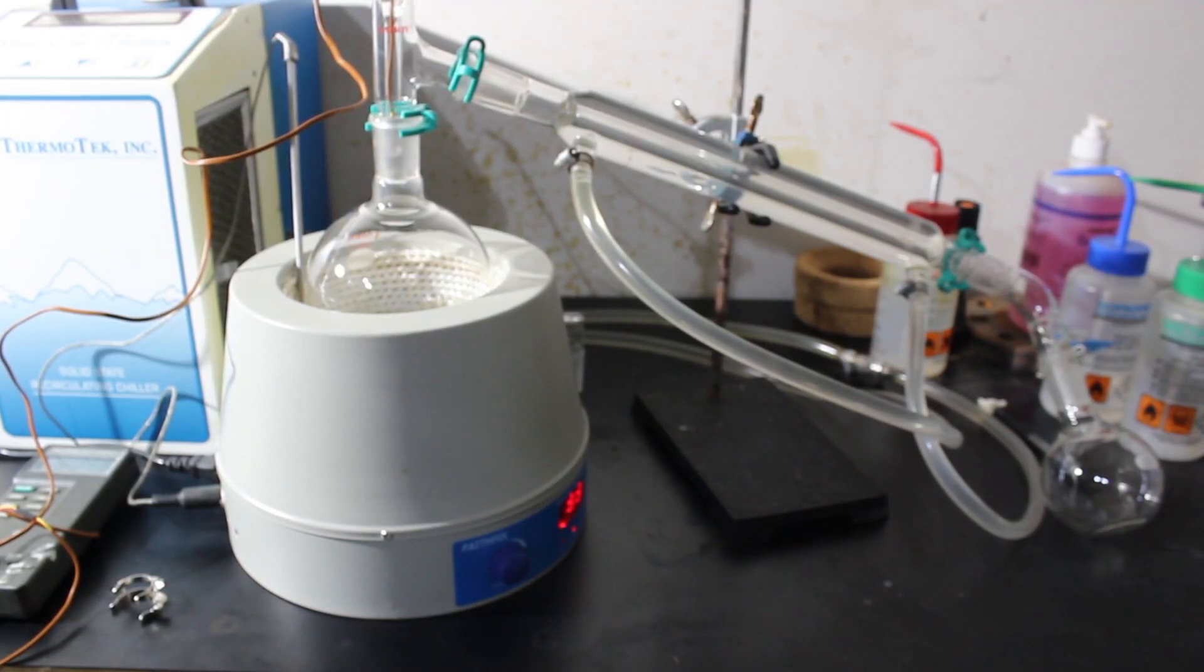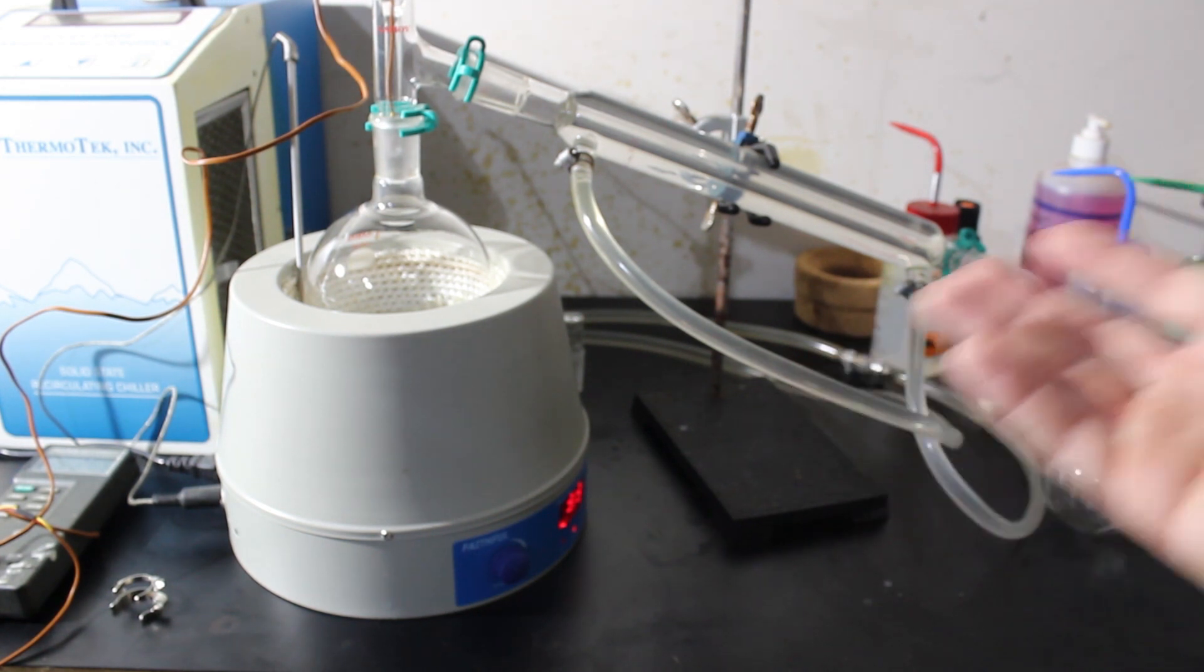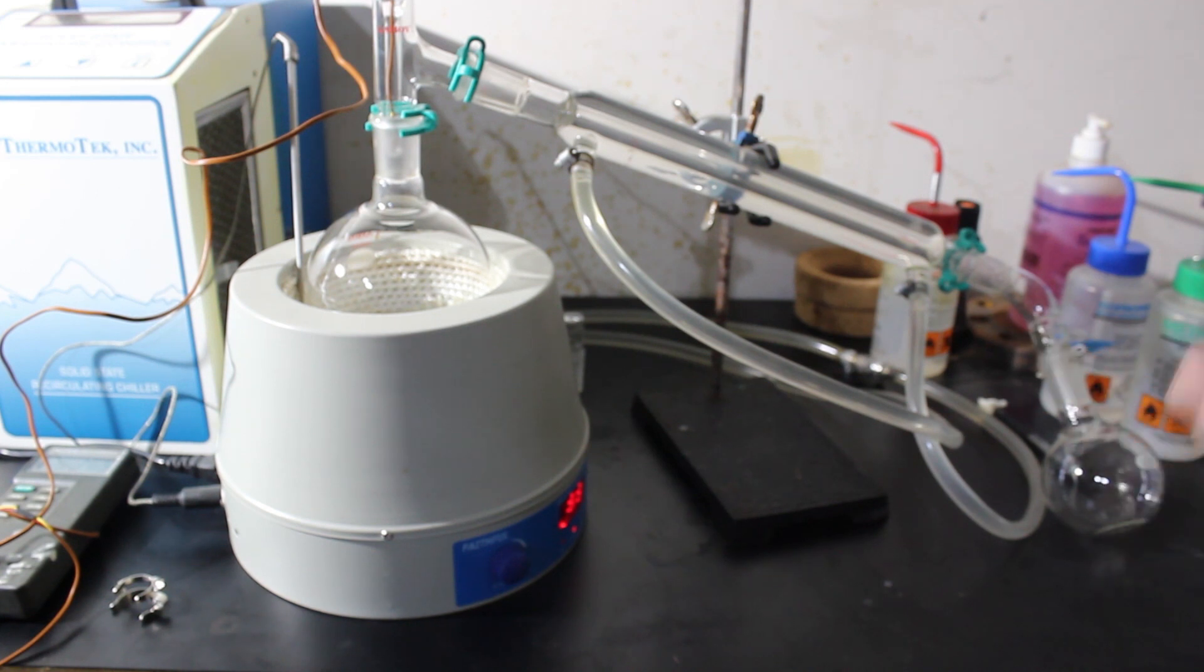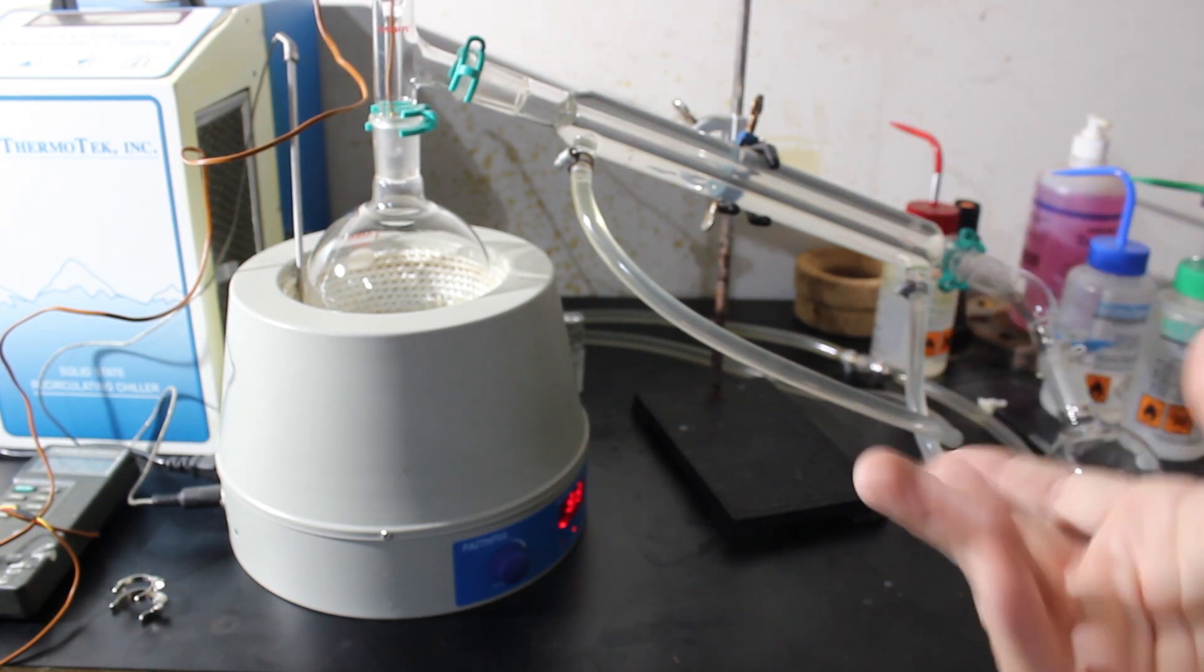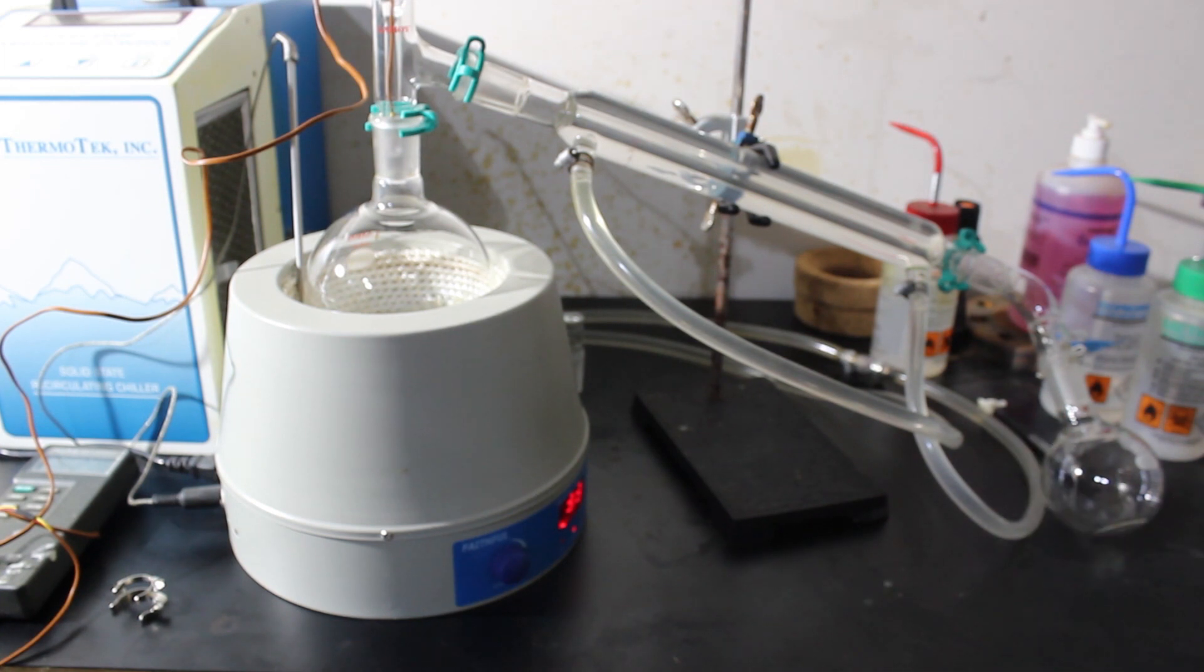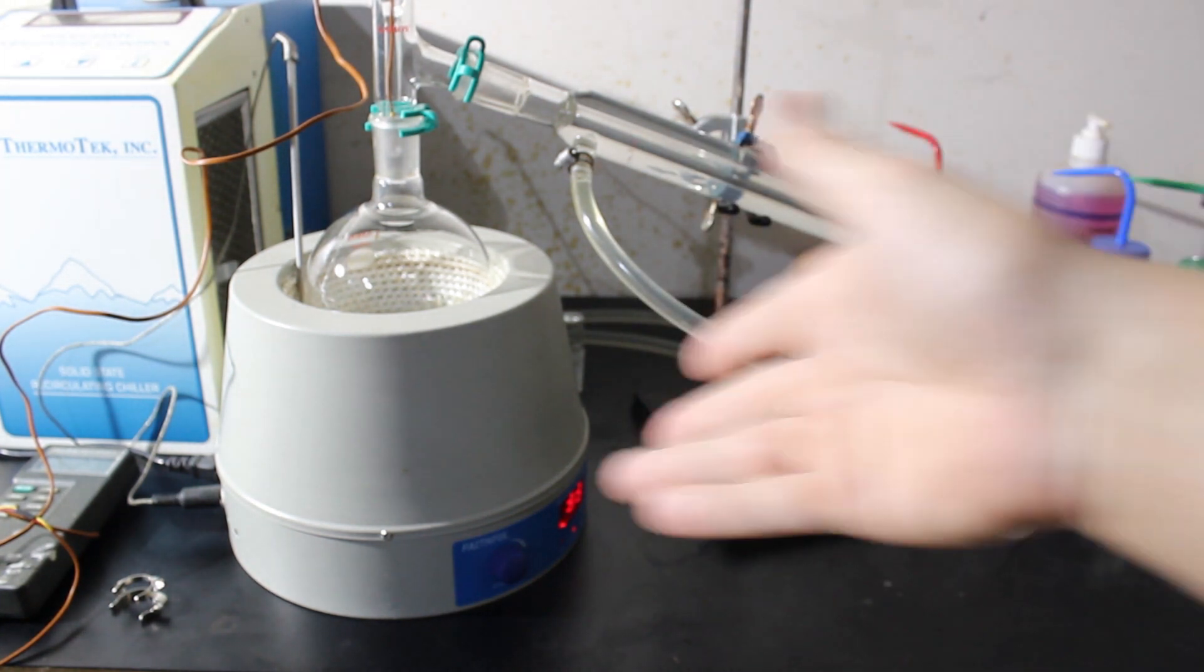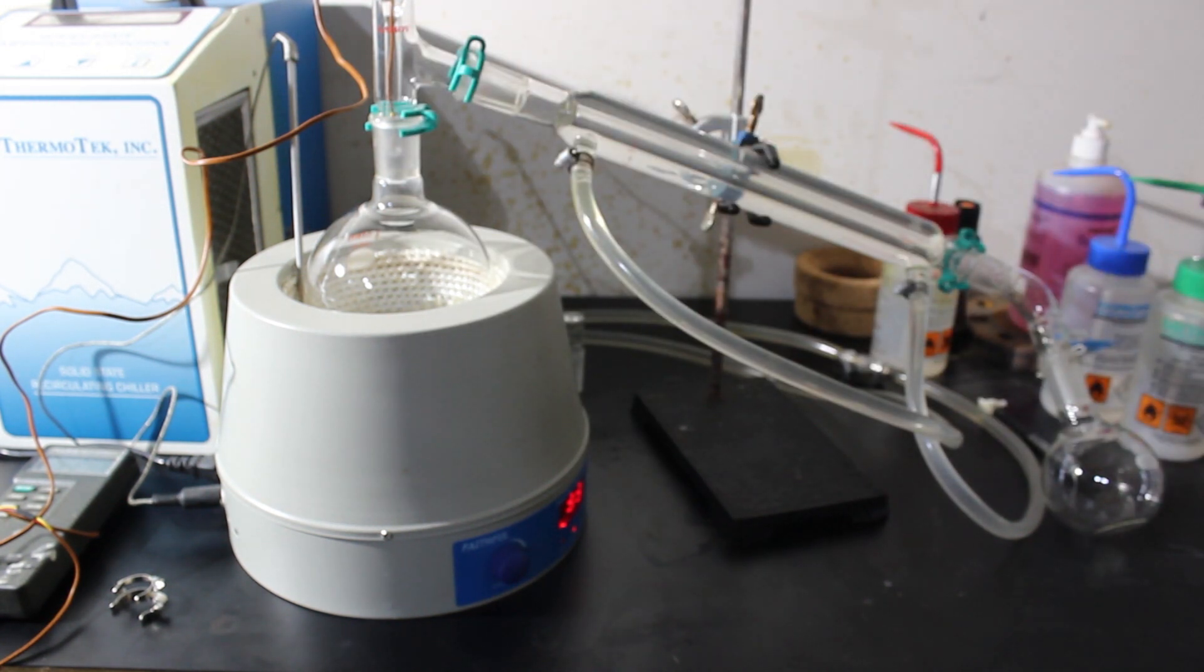Okay, so got my reaction mixture, it's been sitting forever. We're going to be doing distillation, collecting over here on the right. I've got the chilling water cooling down right now. Once that's done then the distillation will be on the way.